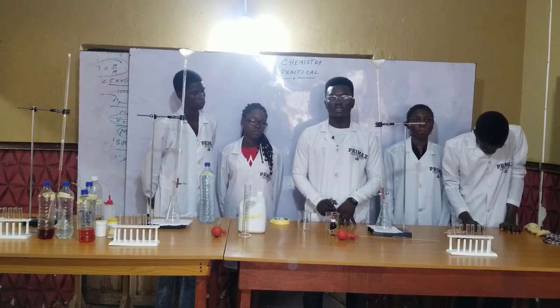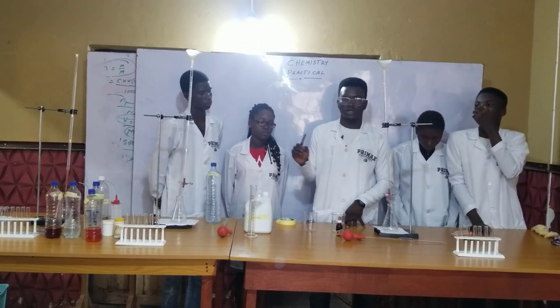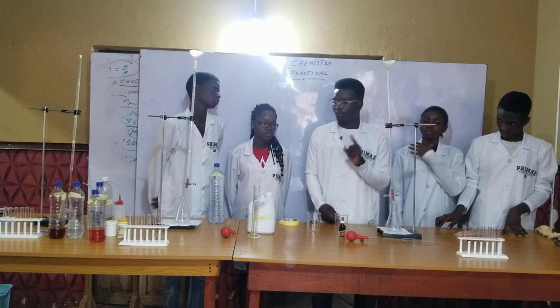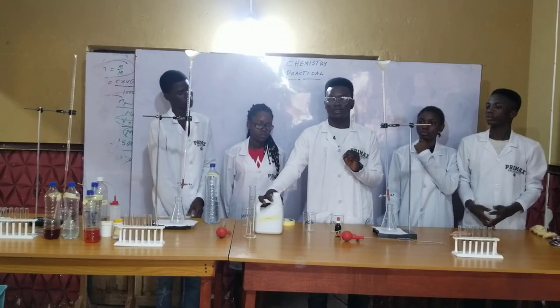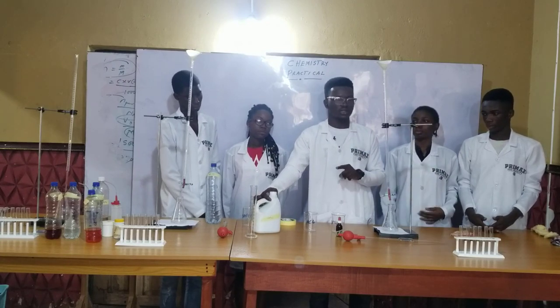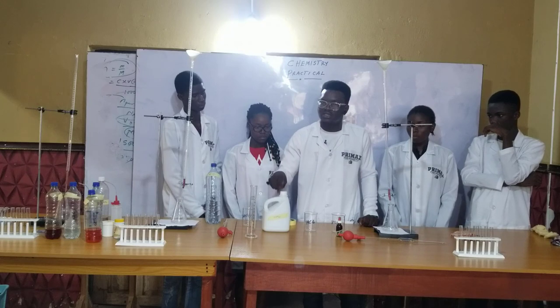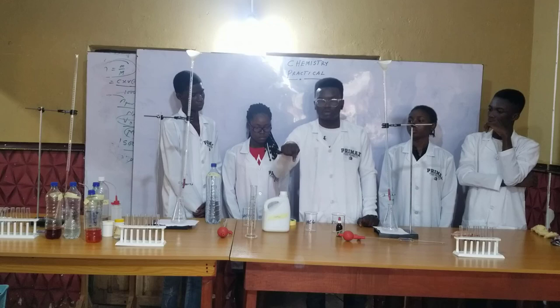The first part is quantitative analysis, where you are going to be carrying out titration in order to know the concentration of a particular solution. One of them will be given — that one is called a standard solution. A standard solution is a solution whose concentration you already know, prepared by dissolving a particular mass of the base in water, so we can calculate its concentration.